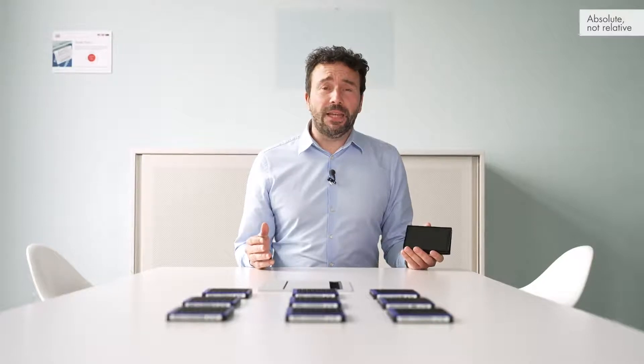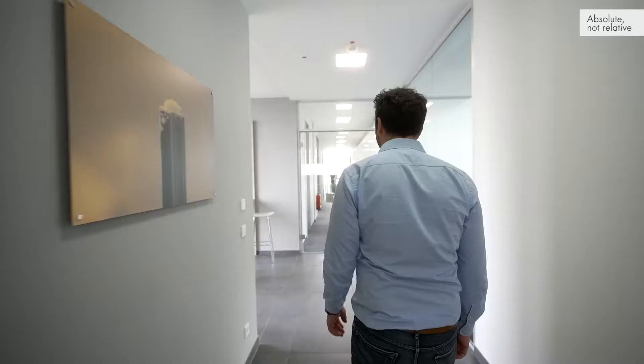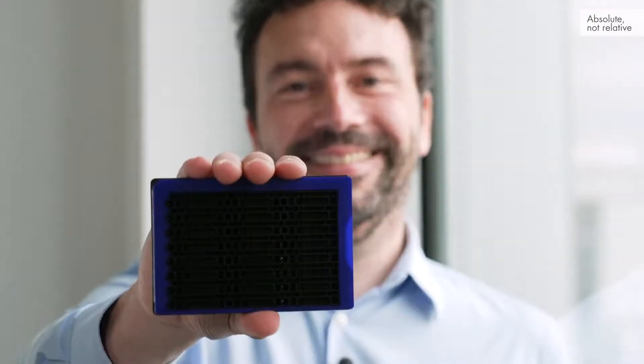This brings another level of precision for digital PCR. With the nanoplates we have specifications within the plate: 26,000 or 8,500 partitions, 24 or 96 wells — so you can choose what you need, or we can build what you might need in future. The channels and partition sizes allow single cells to fit in there, so I'm really curious which future experiments and applications you come up with.